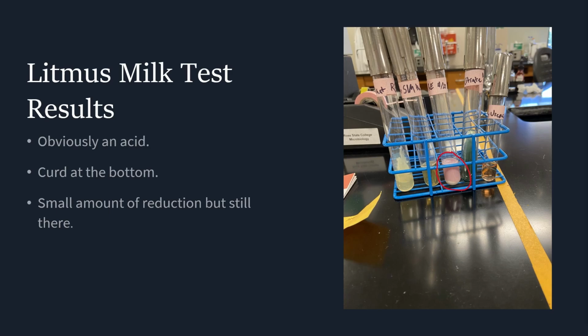From then on, we used the litmus milk test, and it went from a deep-ish purple color to a pretty bright pink color, indicating that it is very much an acid. And there's a bit of a white curd at the bottom, so we can conclude that a reduction occurred with curd.